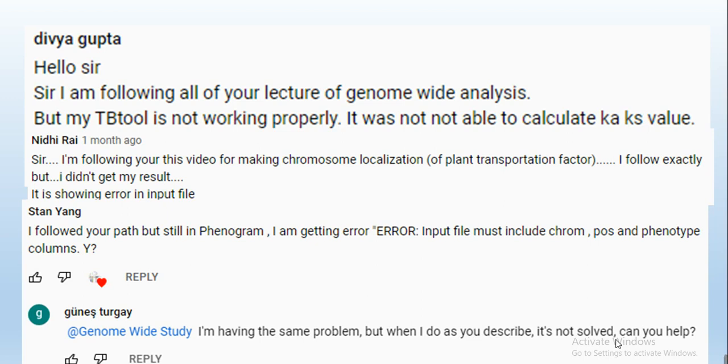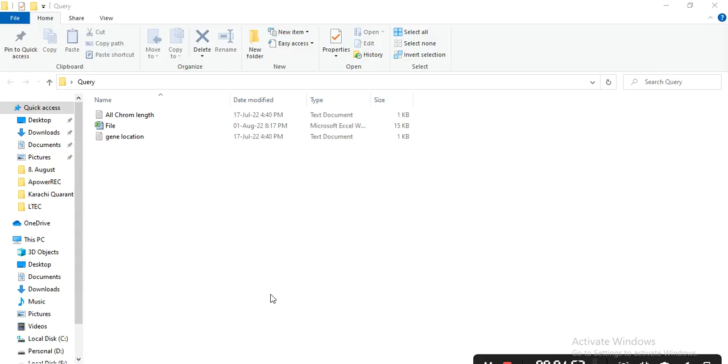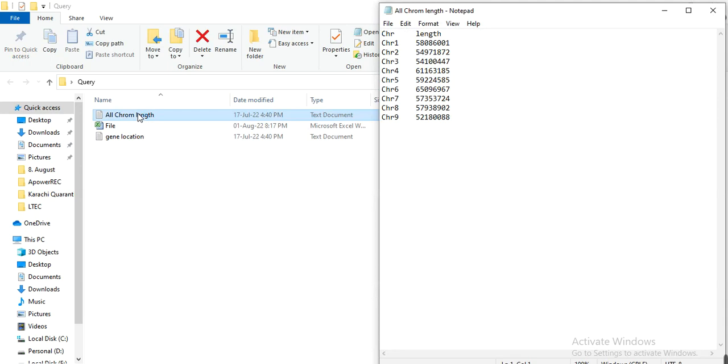So these are some comments on the video, and I also received many texts on my WhatsApp and email. So now I decided to make a video on how we can overcome this error. Let's start. I have received these two files from one of my viewers, and he said that he is using these input files and also gets that error. So first we use these input files and check whether it gives the error or not. After that we will try to figure out the solution.